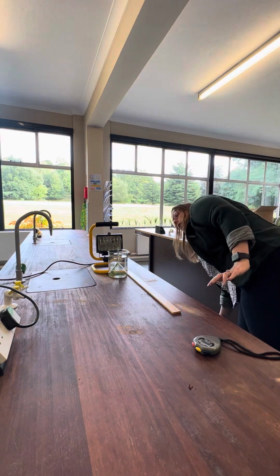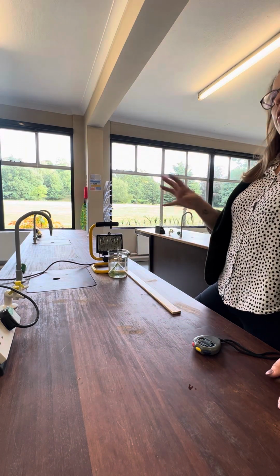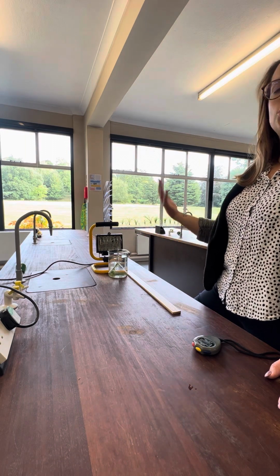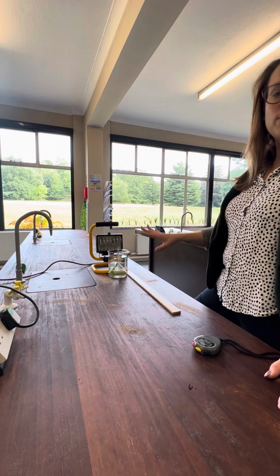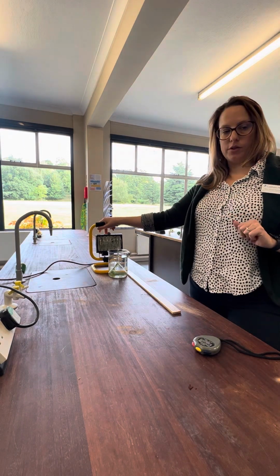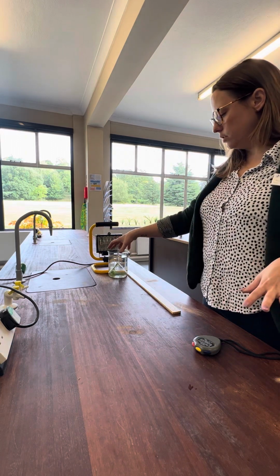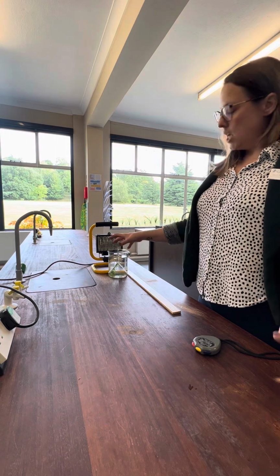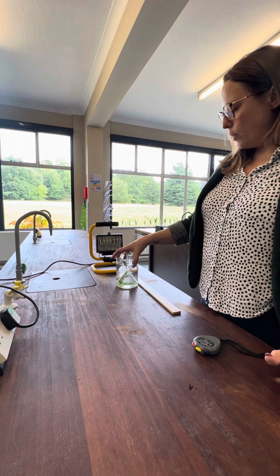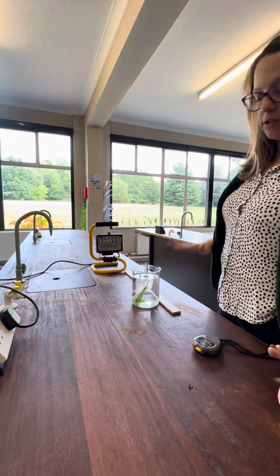So I'm currently using 500 centimetres cubed of solution, so that I know exactly how much is in there, so that my carbon dioxide and my water do not become limiting factors. I don't need those to become limiting factors. I only want to investigate how my light affects the rate of photosynthesis here. So as I go through and do my practical, what I should see is that as I move my pondweed further away from the lamp, my rate of photosynthesis is going to decrease.